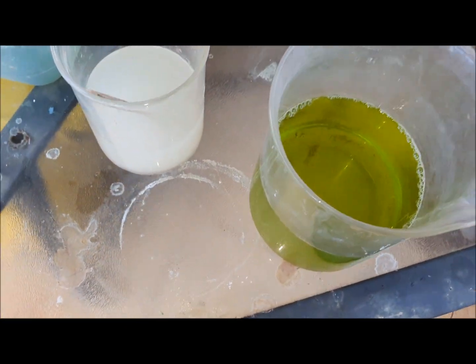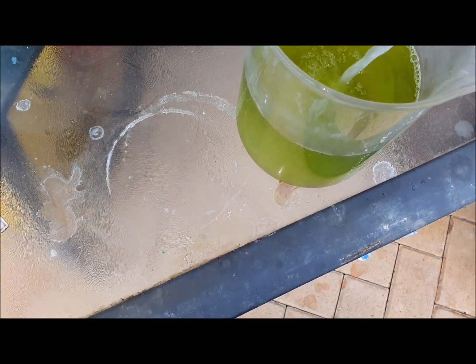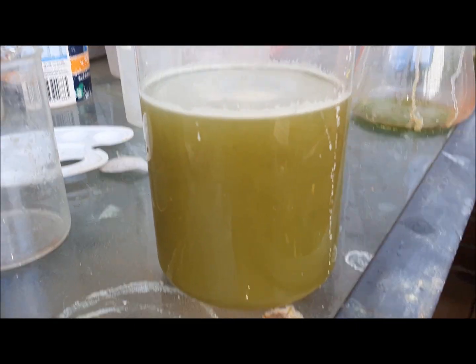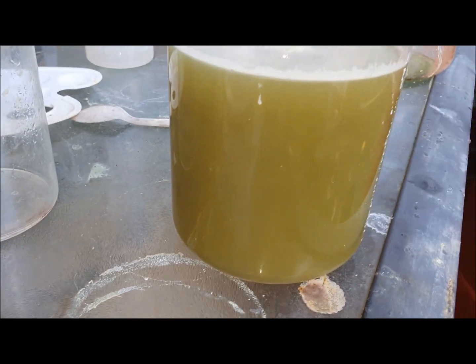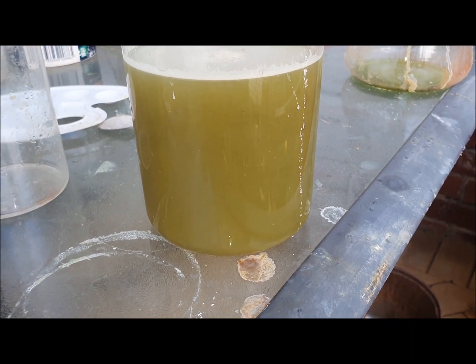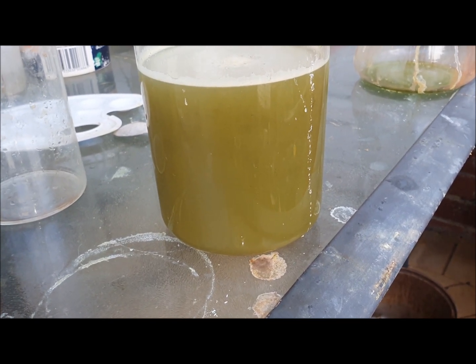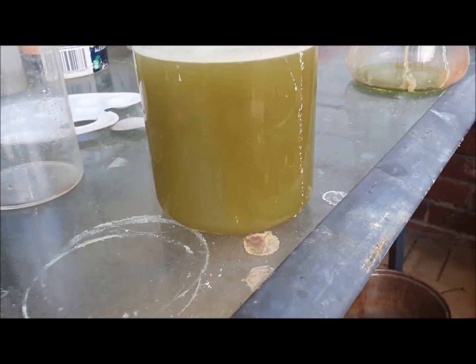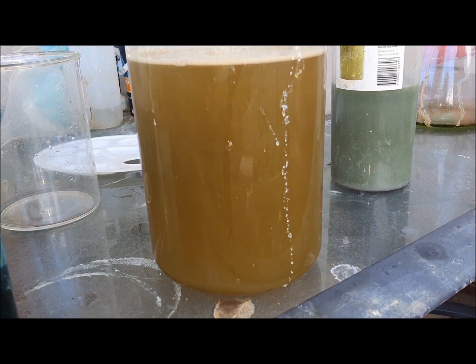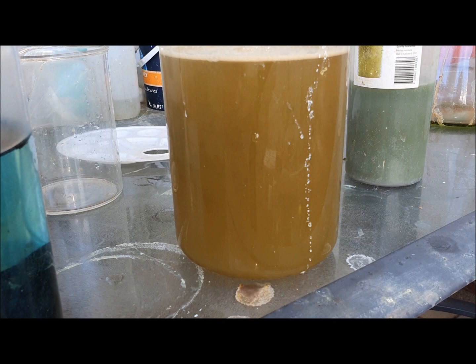I've dropped — sorry, filtered — the gold, and now I'm going to pour in the SMB. Let's see what we've got. There's some in the beaker, I've got to squirt it. It's taking a while but it's slowly starting to change color — that usually indicates there's not much gold. I'll give it a while and then test it to see if there's any more in solution. Maybe I haven't put enough SMB in, but I'm not expecting a lot. I'll put some more SMB in — you've got the white foam on top that you're supposed to get. It's continuing to change but there's really won't be a lot of gold in there.